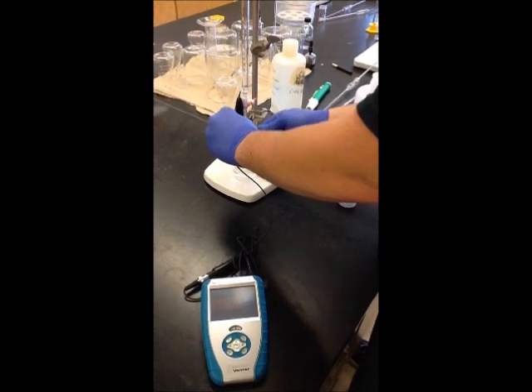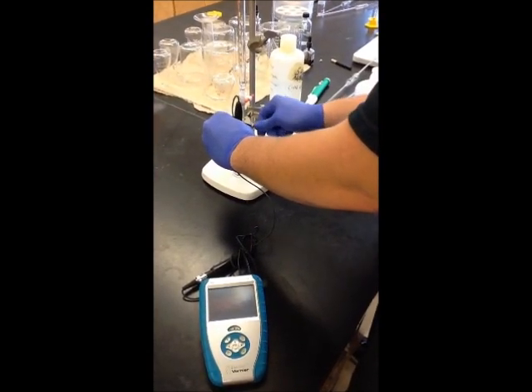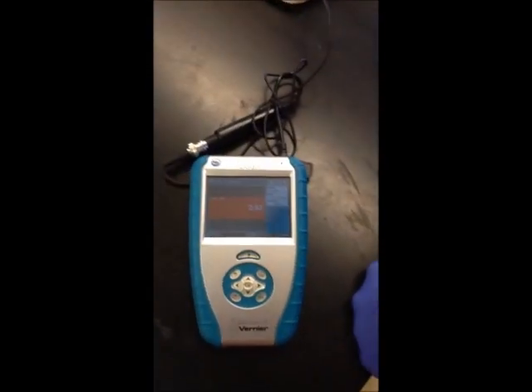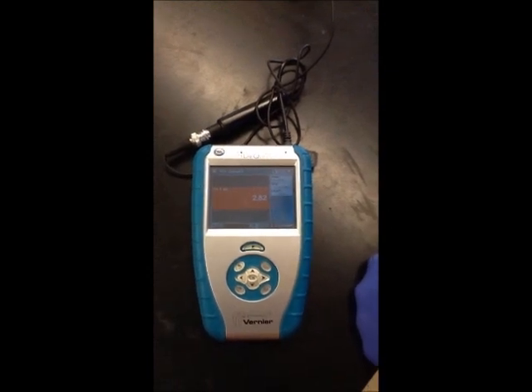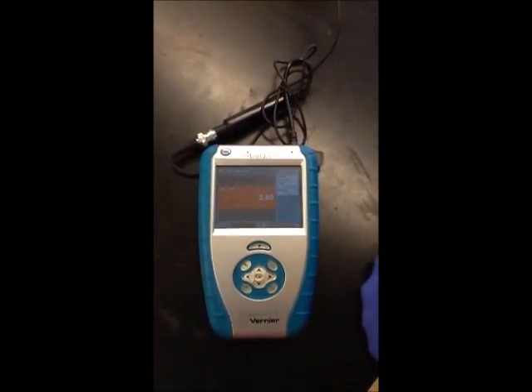Drop the pH probe in there and be sure that it's reading approximately the right pH. Because it's showing an acidic solution and it's been calibrated, I'm pretty sure it's the correct pH.